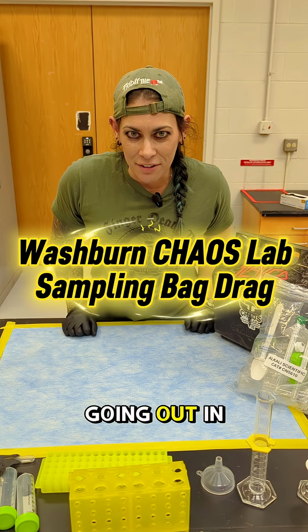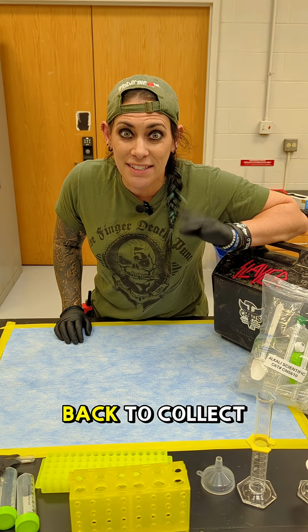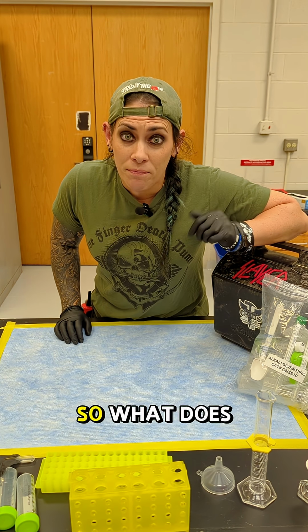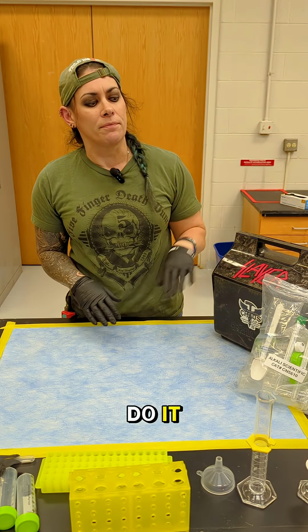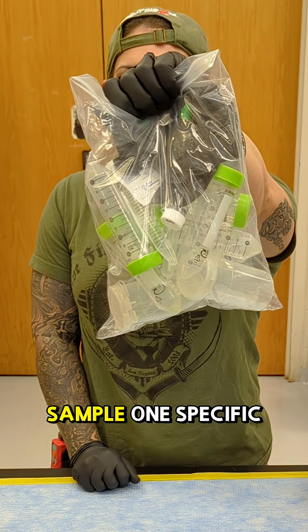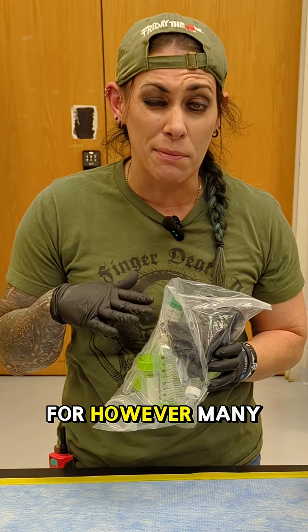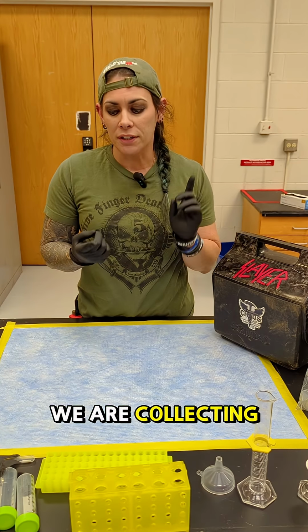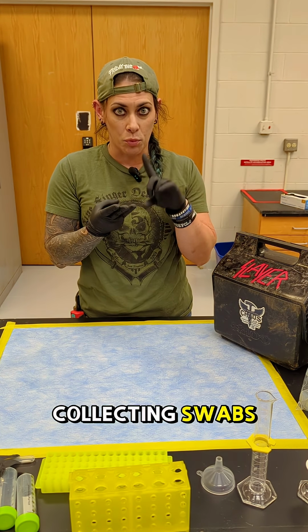So tomorrow we're going out in the field, back to the cave, back to do some feral cave science, back to collect samples. So what does Chaos Lab use for their sample collection kits? How do we do it? Each one of these bags contains everything that we need in order to sample one specific sample site. So I'll bring a whole bunch of these for however many sites I want to sample. We are collecting water, we are collecting sediment, and we are collecting swabs.